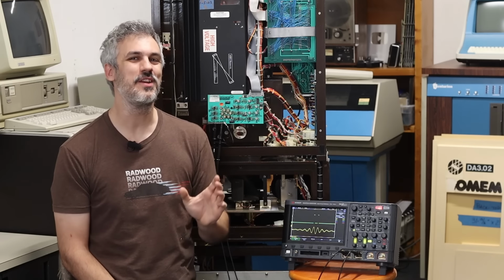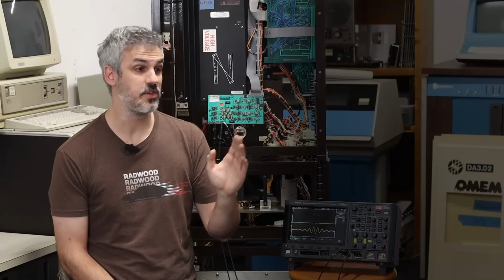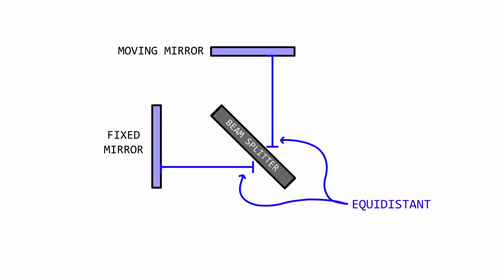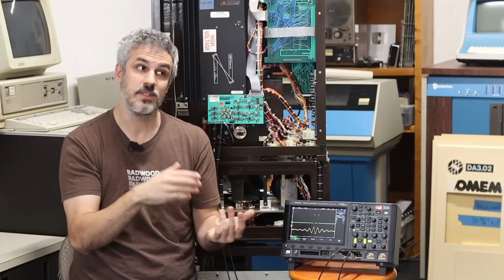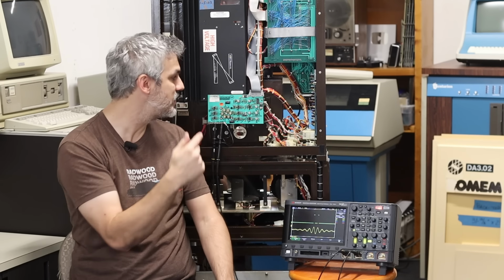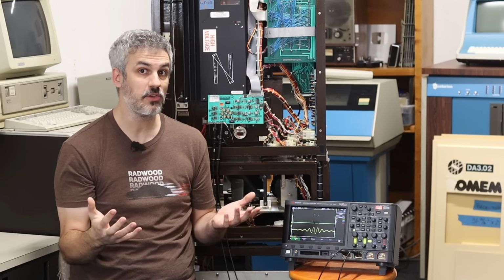At this point, what we're trying to do is lock down the ZPD detection. ZPD stands for zero path difference. This is the point at which the fixed mirror and the moving mirror are equidistant from the beam splitter, which means that every little bit of light that passes through the optical path is going to be constructively interfering. And since we have a little bit of white light passing through that optical path that is hitting the Z sensor on this board, we're essentially doing spectroscopy.